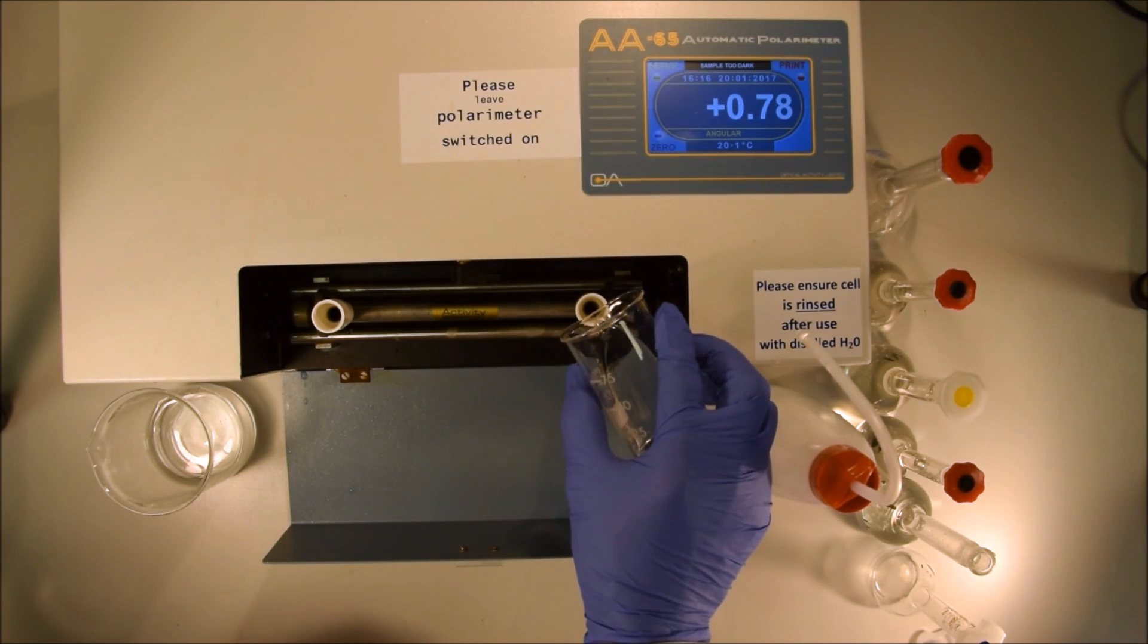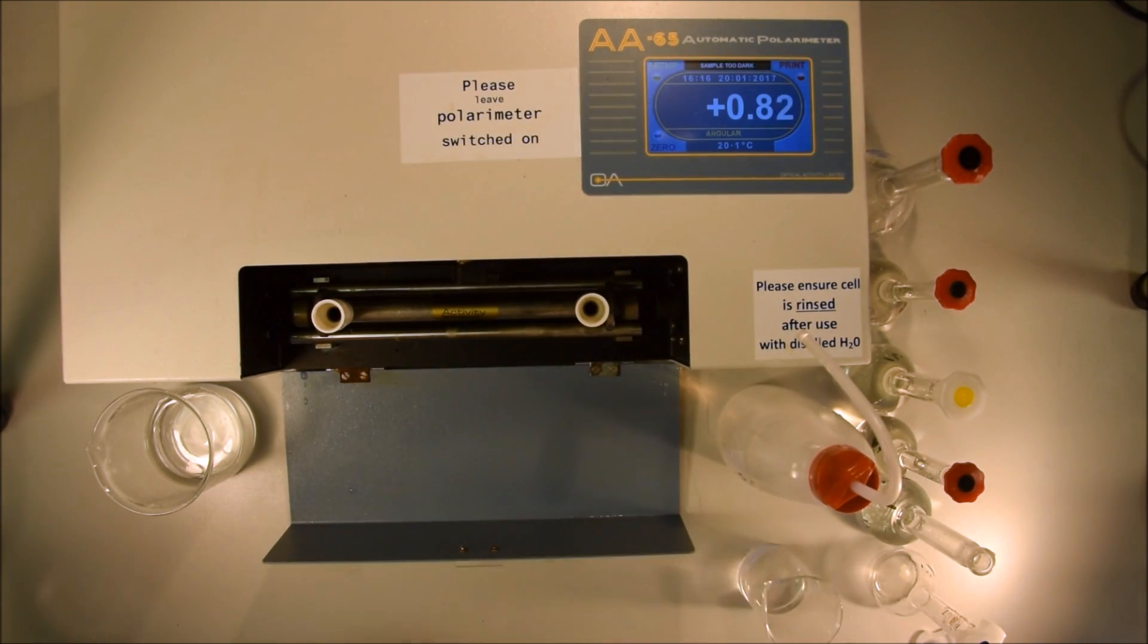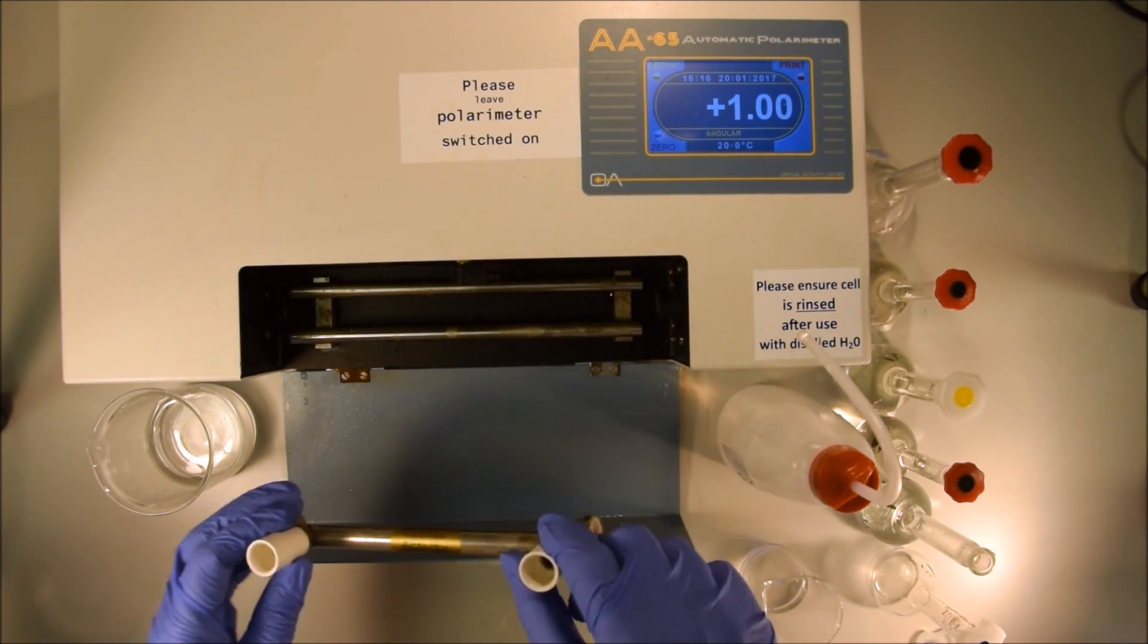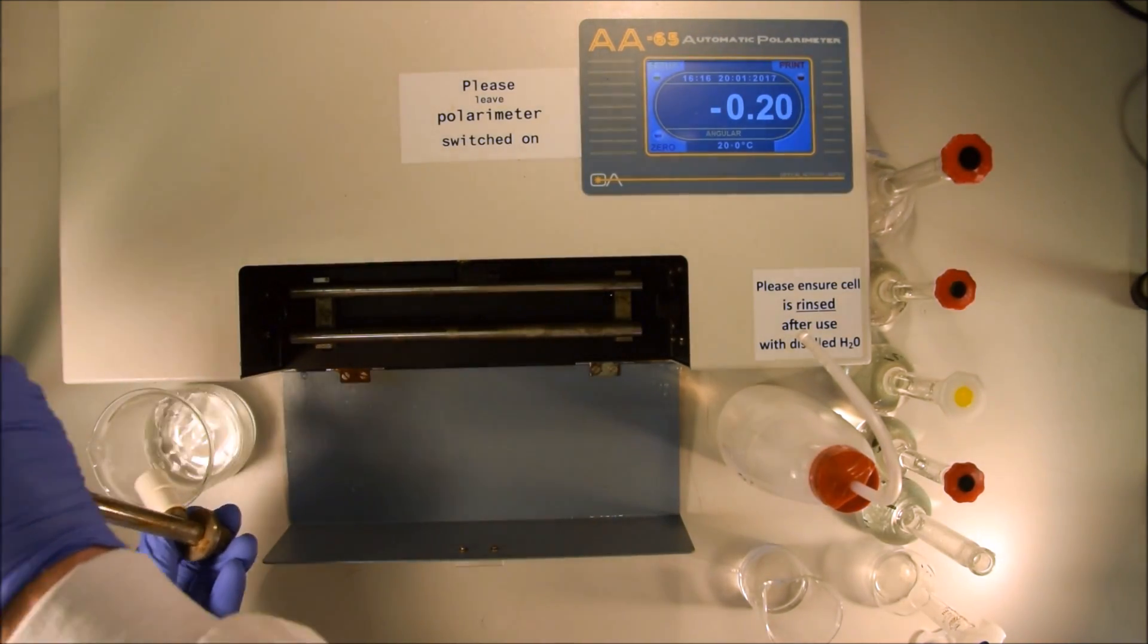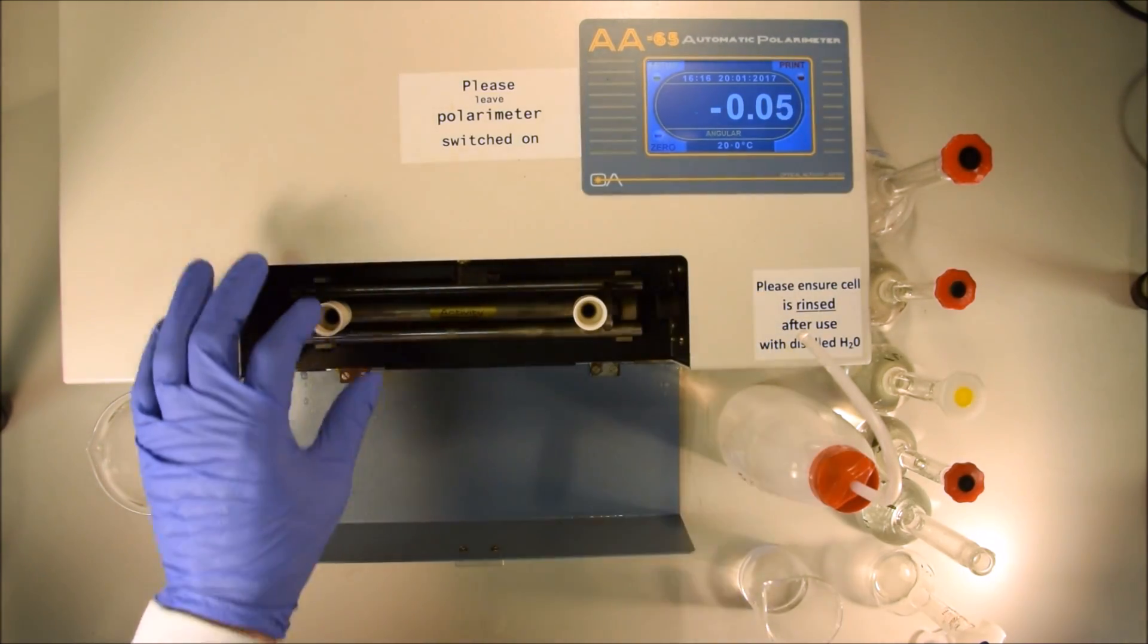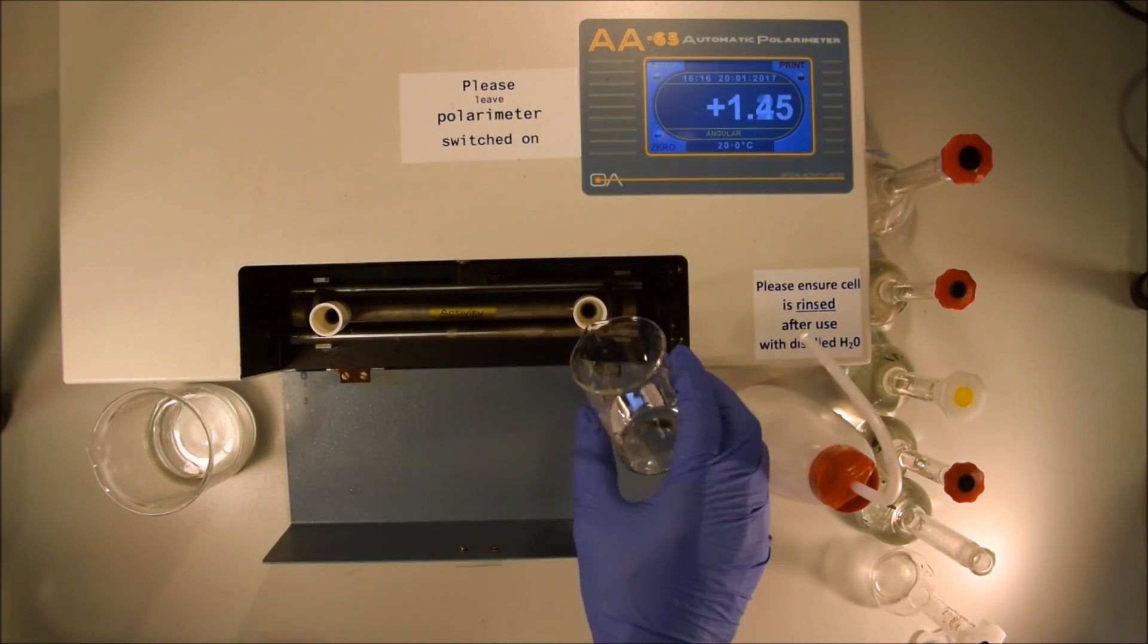What we're going to do now is make measurements for each of our different standards. Before we do that, it's very important that we clean the cell out between each reading. If we don't clean the cell out between each reading, our readings will be off, sometimes substantially.